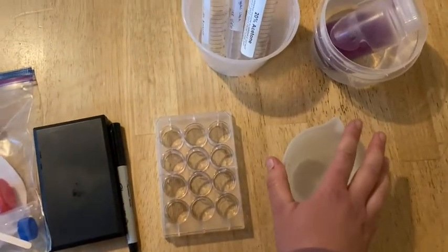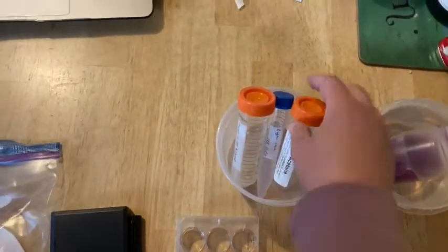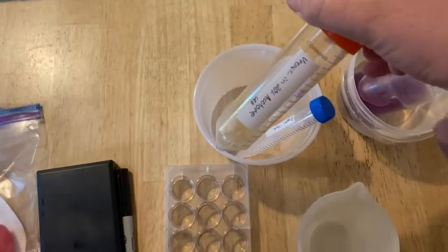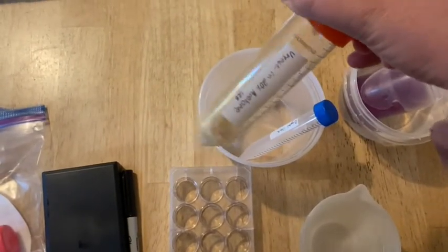A cup of water, just room temperature tap water is fine, and then some of your supplies from previous labs. Specifically, you'll want your urease and 20% acetone from the previous lab that you did.